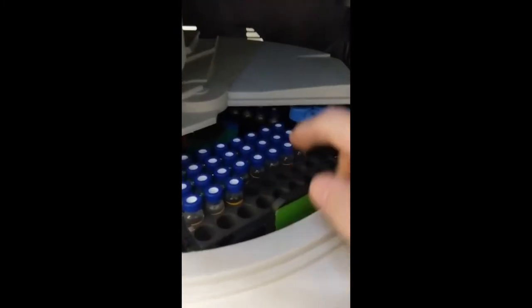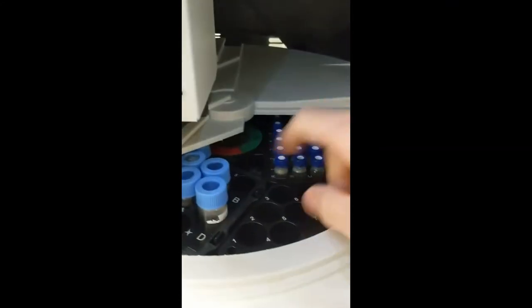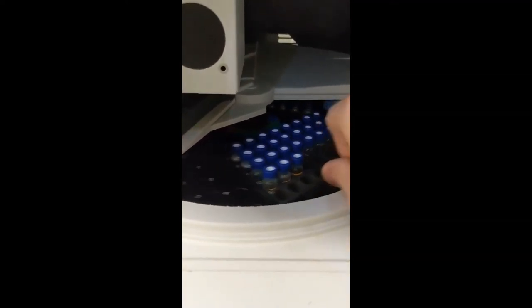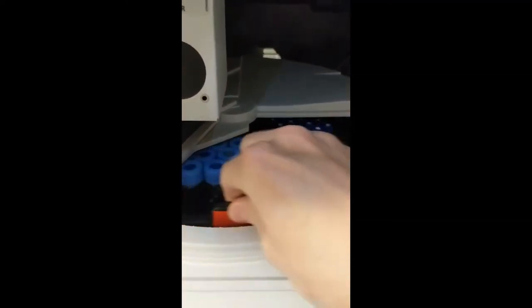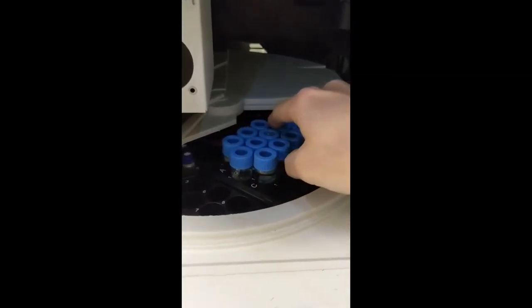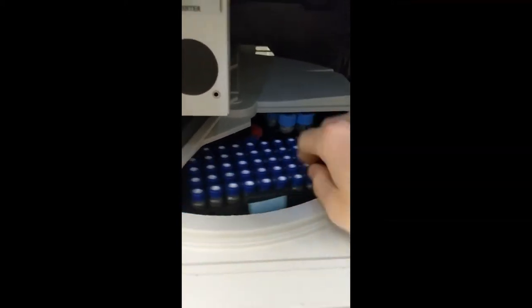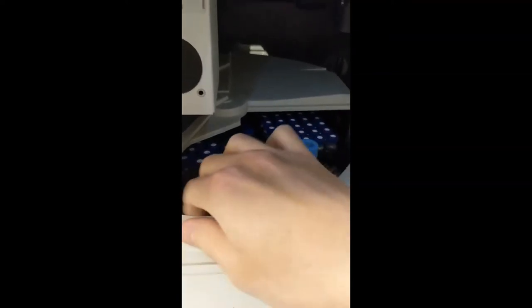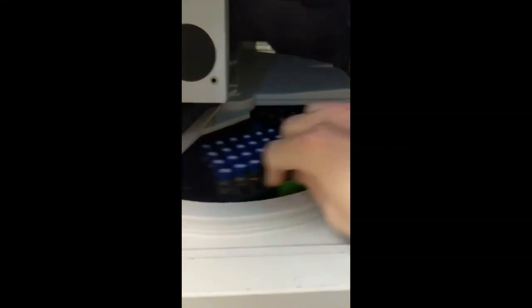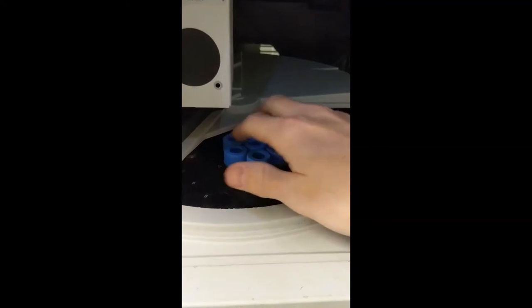You can see that the trays have different colors — green, blue, and red — and we put tape on the front of these so that we know which tray goes where. There are also different vial sizes. The large ones, about 10 milliliters, we use for our DI waters, our anion calibration standards, and our cation calibration standards. The blue and green slots we use for our actual samples. Remember: calibration curve goes in the red tray, anions here, cations here, and DI waters here.